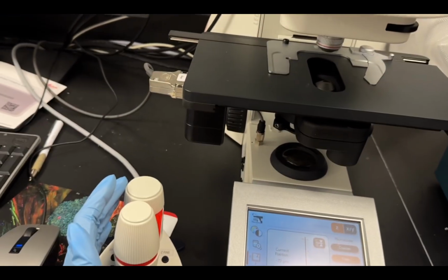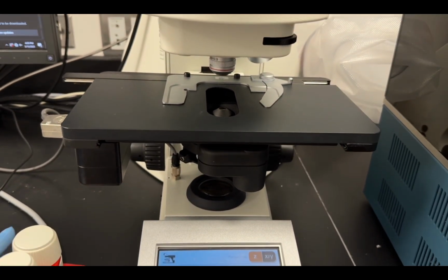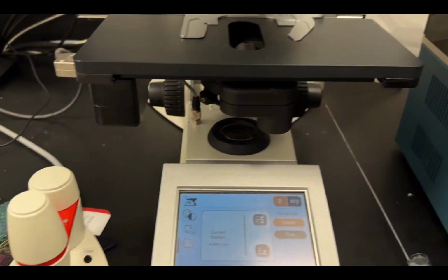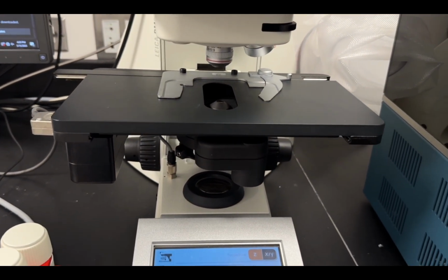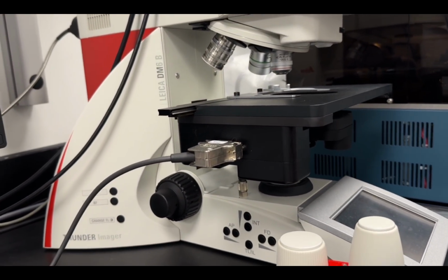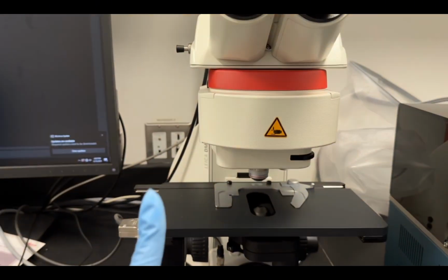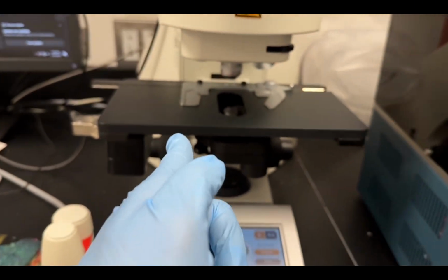So you'll see as I shift this here, the stage is moving up and down. This up and down, that's what this top knob is. You'll see this one as I move it. Let's show you from this angle actually. Is moving it front and back. So this knob is that way and this way. Back knob is up and down. Front knob is towards you and away from you.